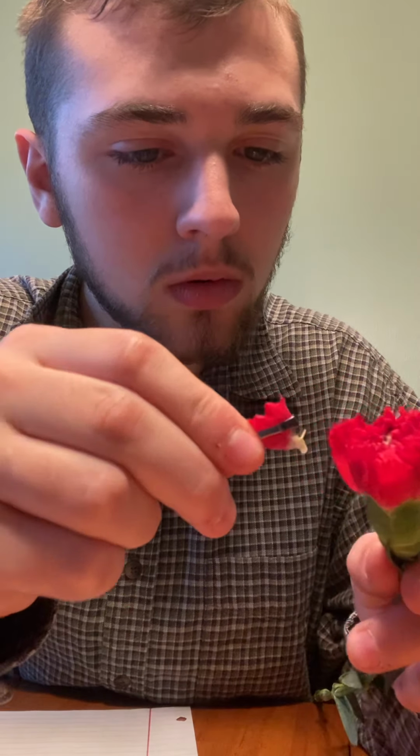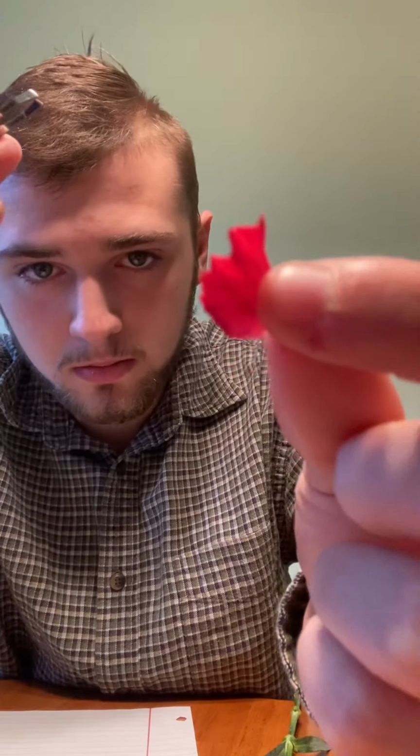And the petals right here. I'll pull one off with some tweezers real quick. There's a petal. As you can tell, it's more net-like because of the fact that it's a dicot. All right, now we're on to the sepals.